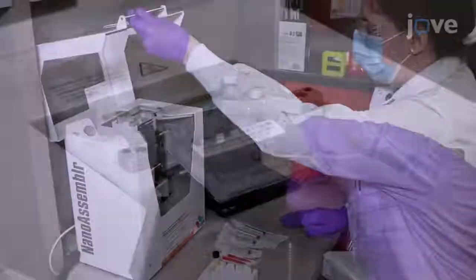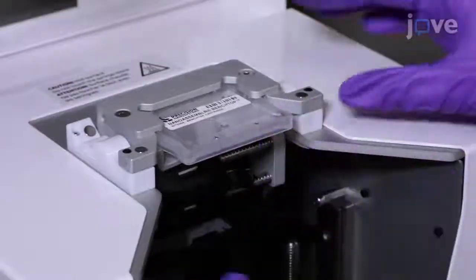Next, open the instrument lid and place a microfluidic cartridge into the rotating block.